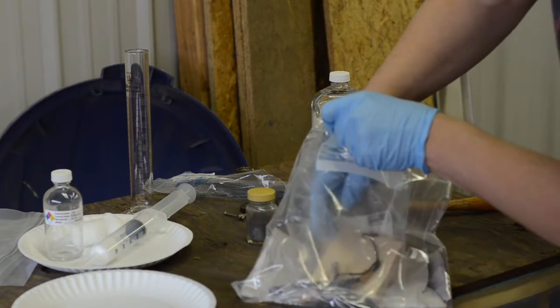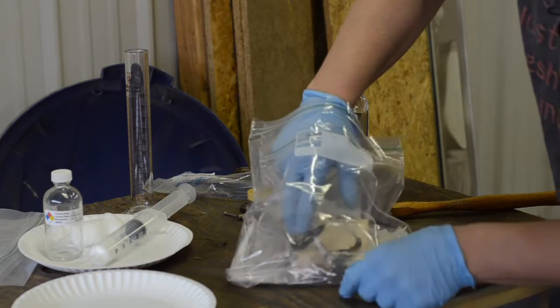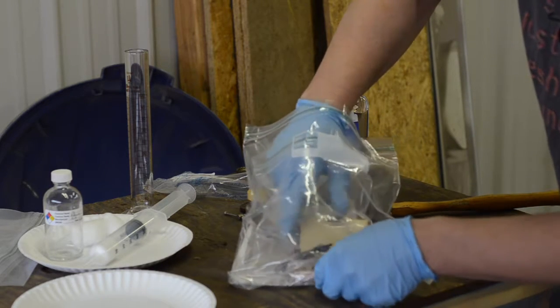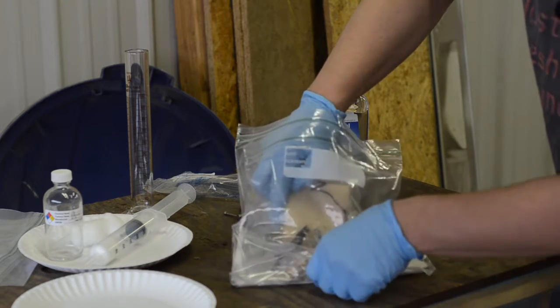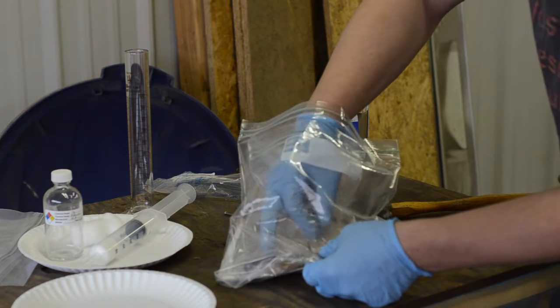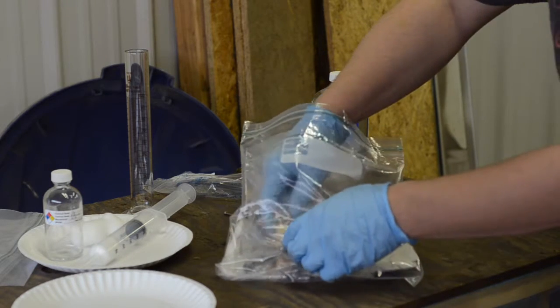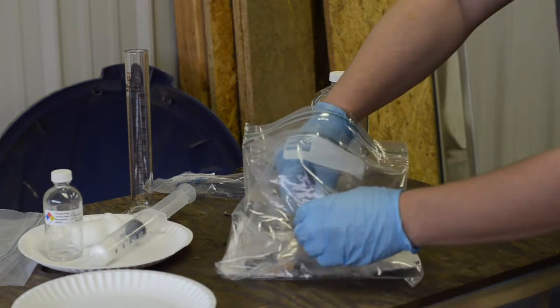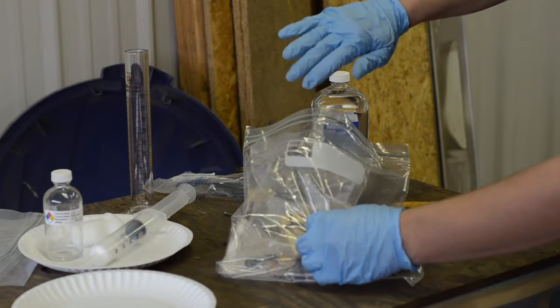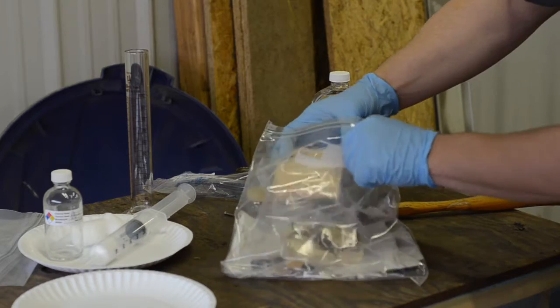And now we just need to get our last one. I know this is really hard to see, but if it was easy to see, then we would not be doing anybody any favors, especially the environment. And then there's our third one on deck. Check that, looks good. Our third block into position here.